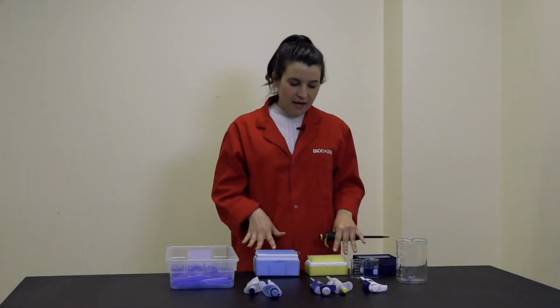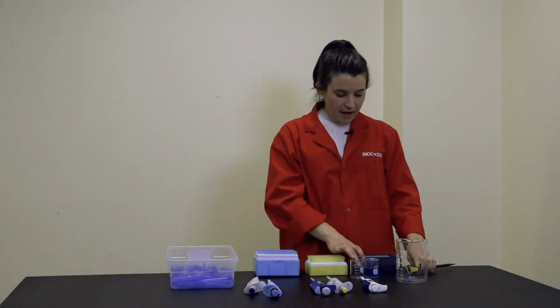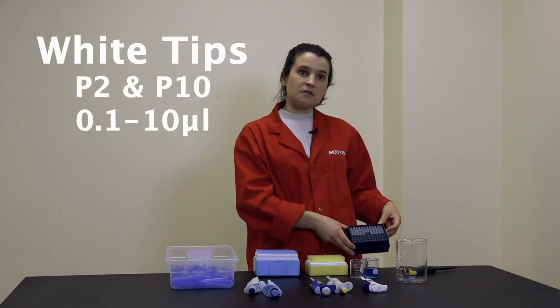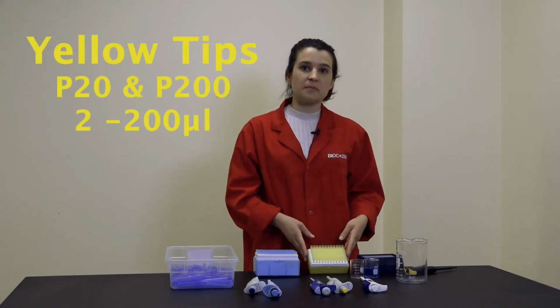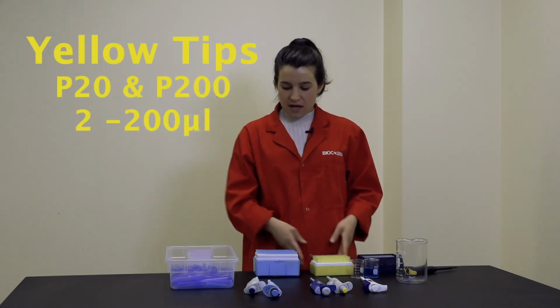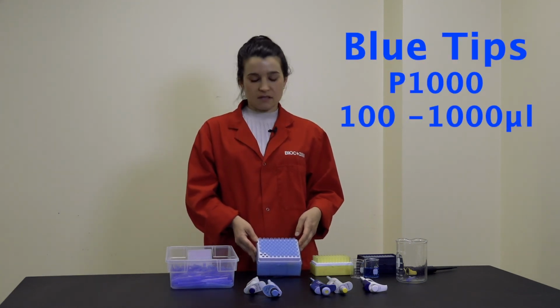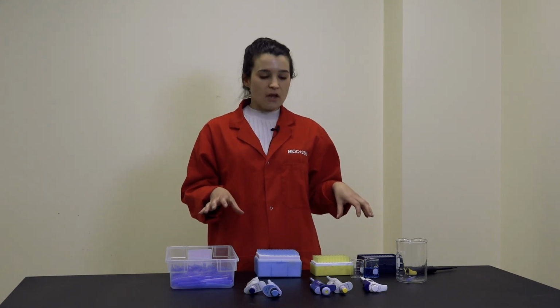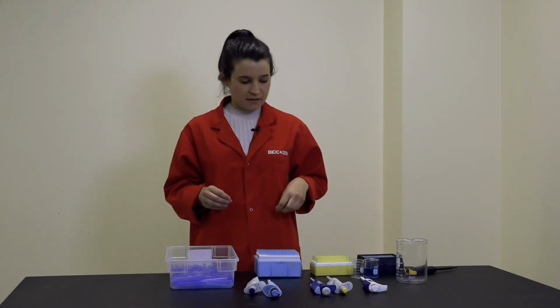We need to make sure we have the appropriate tip in place. So here I have a number of different tip sizes. These white ones are for small volume pipettes, P10s and below. These yellow ones are for P20s and P200s. And these blue ones are for P1000s. Note that these colors are universal, so it doesn't matter what pipette brand or tip brand you're using, you can always follow these color guidelines.